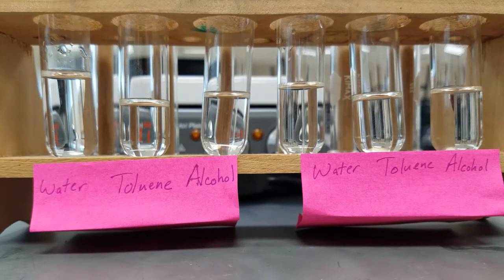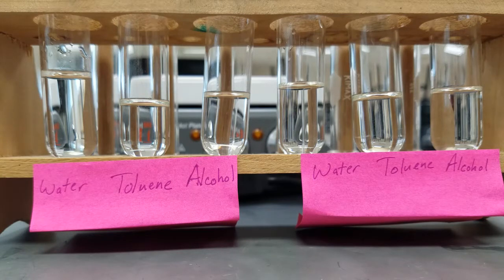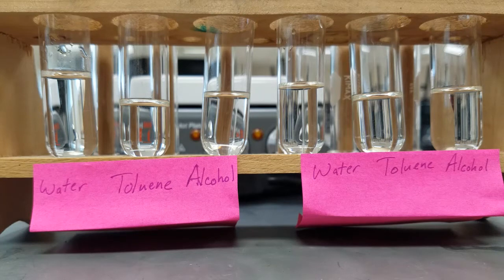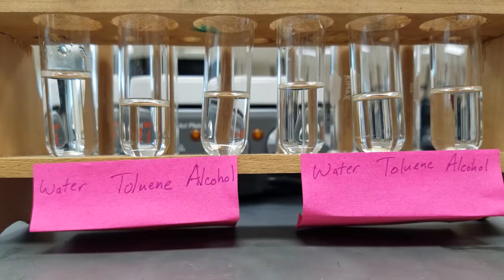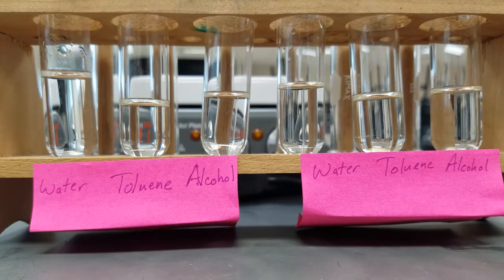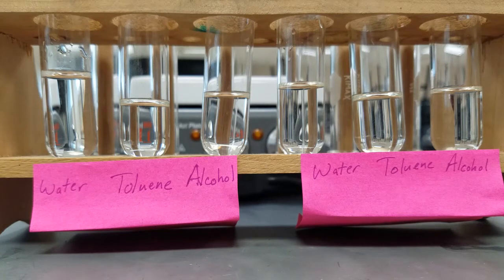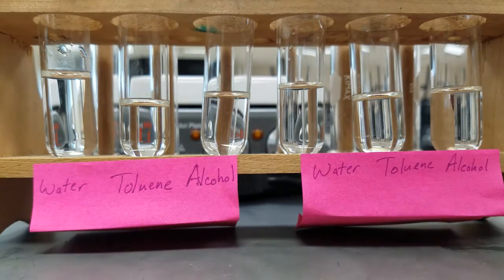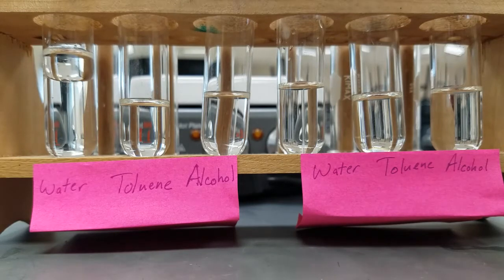We're going to look at solubility using two known substances. On the left hand side we're going to use a known liquid called xylene. There's a table in your lab manual that gives you the identity of several different compounds. We're going to look at xylene and you want to compare this to the table to make sure you're observing what the table says you should.